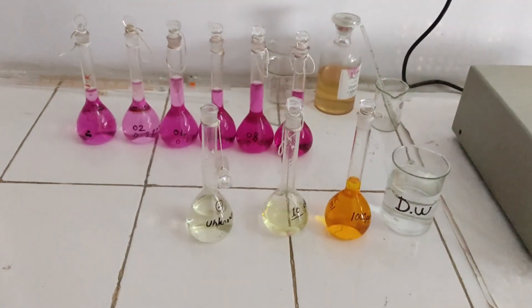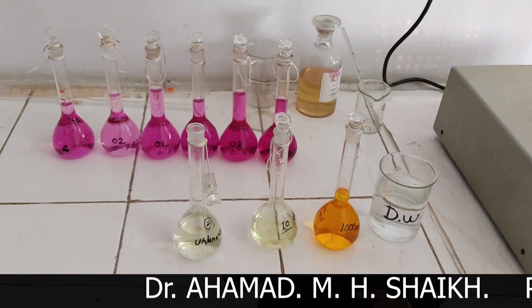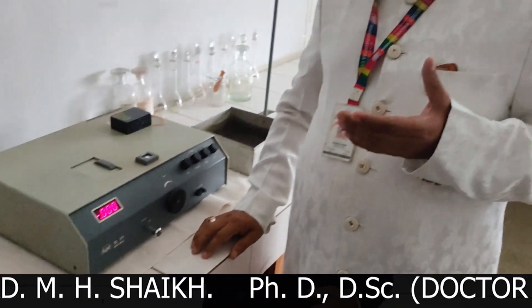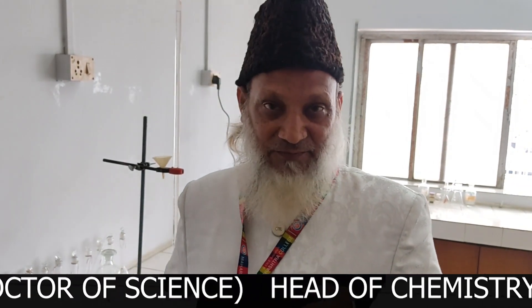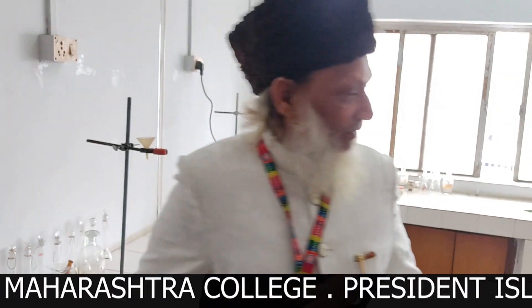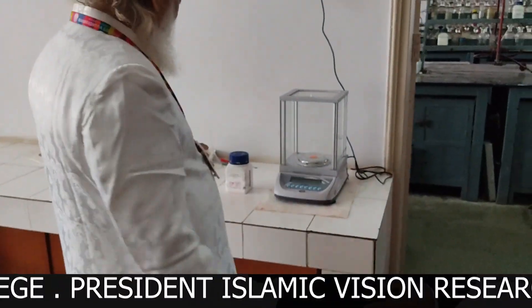In this experiment we are going to determine the percentage amount of chromium⁶⁺ in a water sample. For that, we take potassium dichromate. Here I will take you to the balance — this is the potassium dichromate.